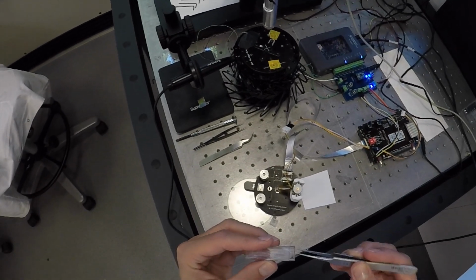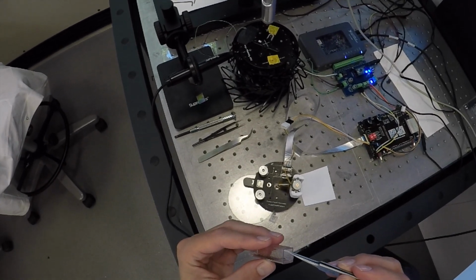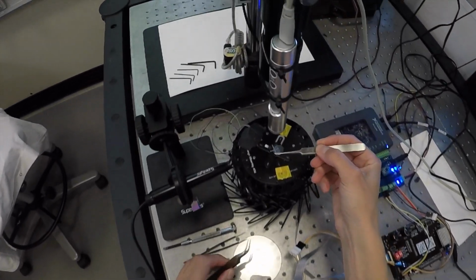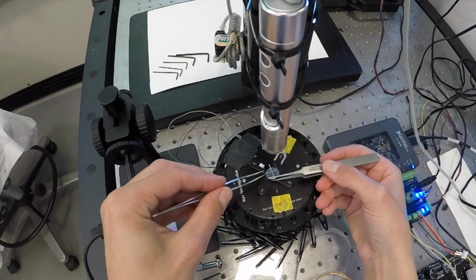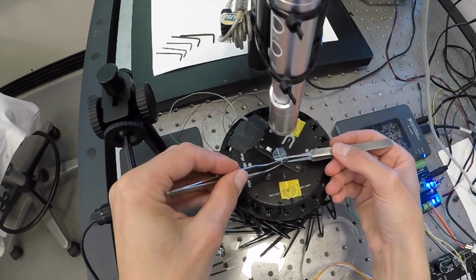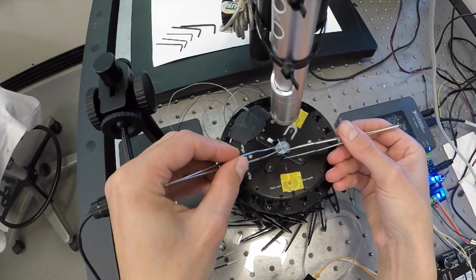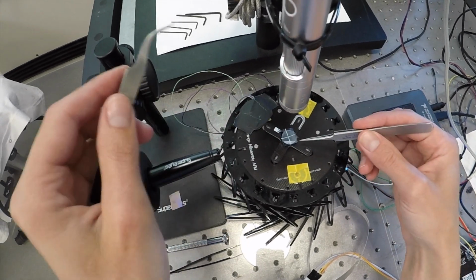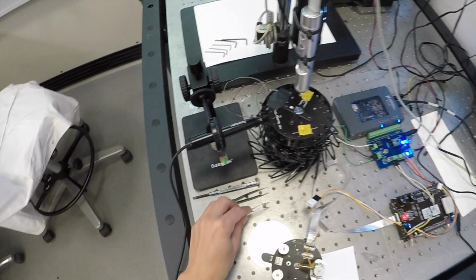Be aware to only have the tweezer on the right area as you hold it, so the rest can be only corner sides. Then you want the sticky part to be going upwards. You can see that by which part sticks to the tweezer, and you have it nearly centered.